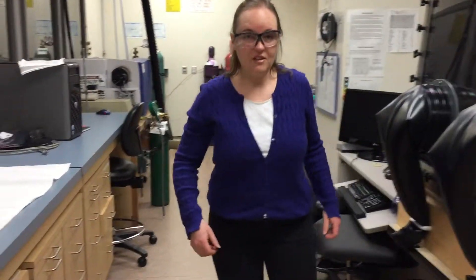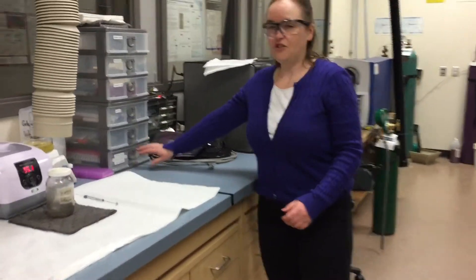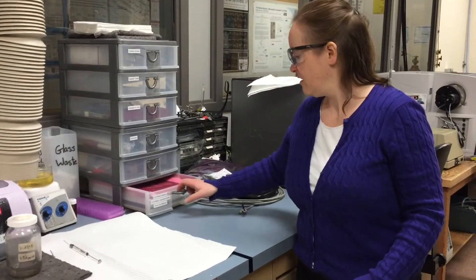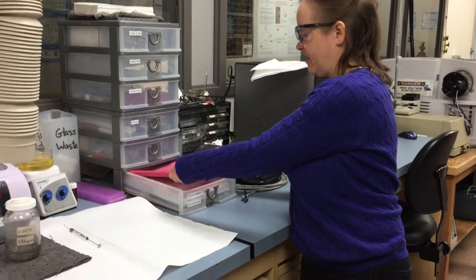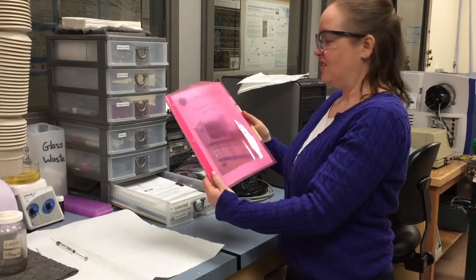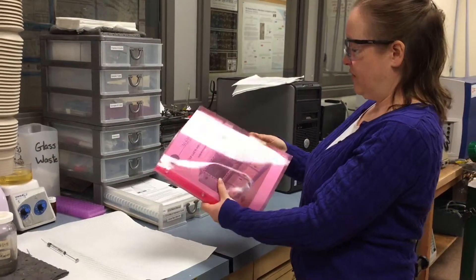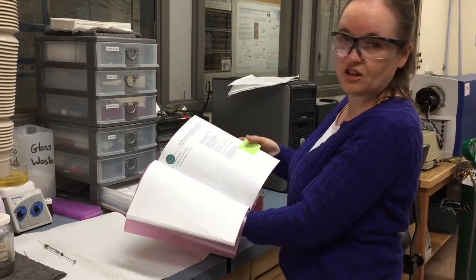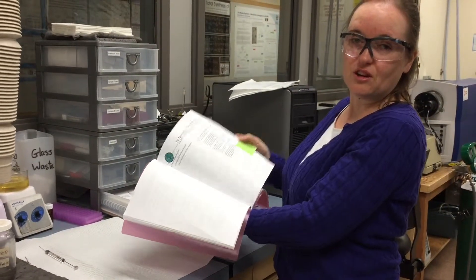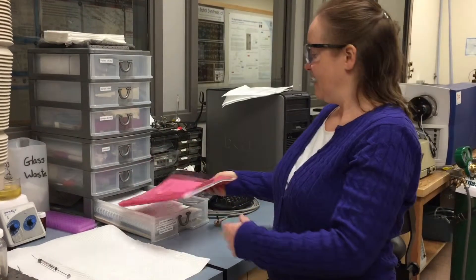Usually we would do this overnight because it could take about 12 hours. If you need to find the manual, it's just over here. In this lovely pink booklet is the manual. And then you can just click over to the regeneration section for more information about glove box regeneration. So congratulations, now you know how to regenerate the glove box. Thank you.